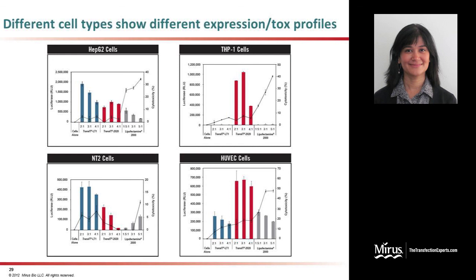Furthermore, it is seen that different cell types show different expression and toxicity profiles than, say, HeLa cells. Here are a few examples of HepG2 cells, THP1 cells, and NT2 cells and HUVEC cells. As you can see here, you do get a good balance of expression versus toxicity that is measured here in terms of luciferase expression versus LDH release with either Transit LT1 or Transit 2020 in most cases. With lipofectamine 2000, you can get moderate levels of expression, but the toxicity levels as measured via the LDH assays are exceedingly high. So this further emphasizes the point that it is very critical to choose the right transfection reagent for your particular cell type.